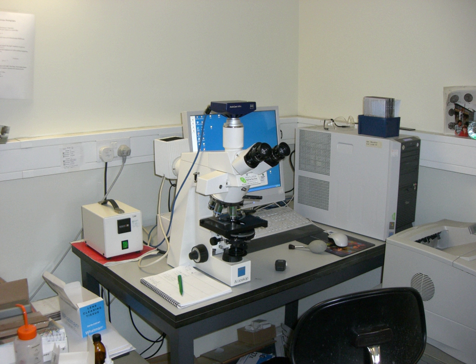Often used in the classroom and at home, unlike the electron microscope which is used for closer viewing. The image from an optical microscope can be captured by normal photosensitive cameras to generate a micrograph. Originally images were captured by photographic film, but modern developments in CMOS and charge-coupled device cameras allow the capture of digital images.